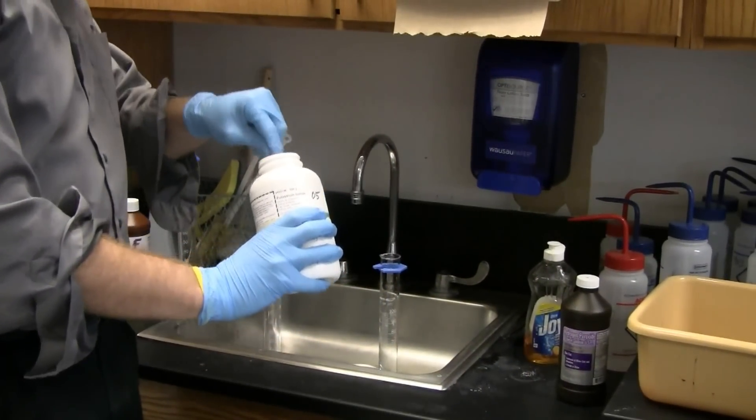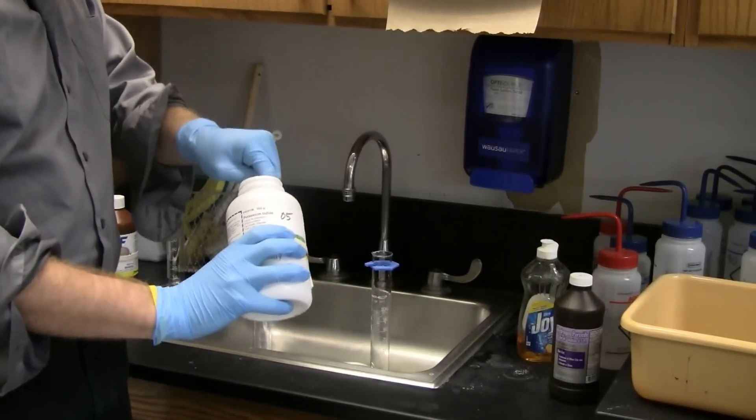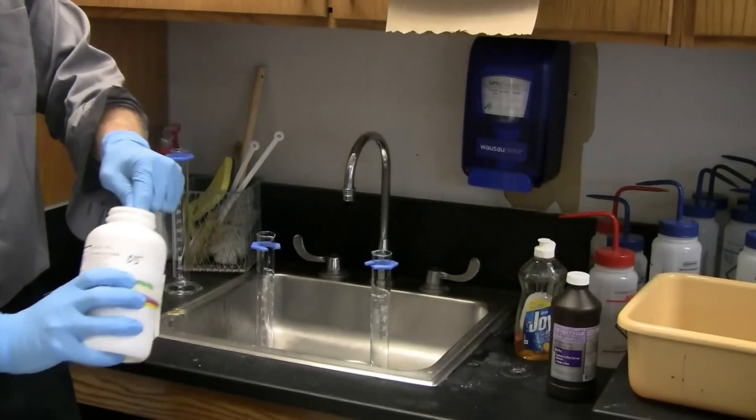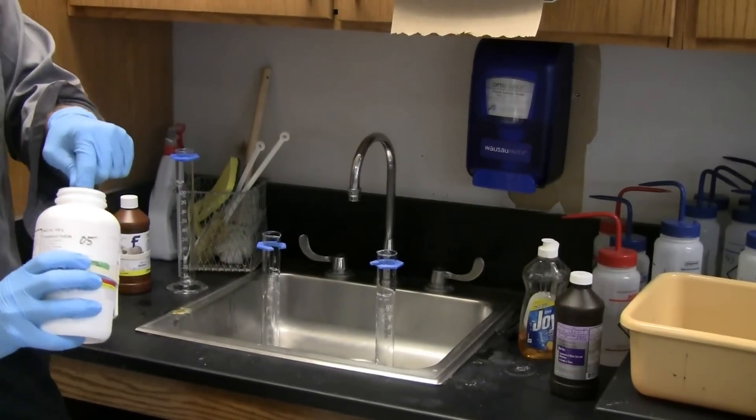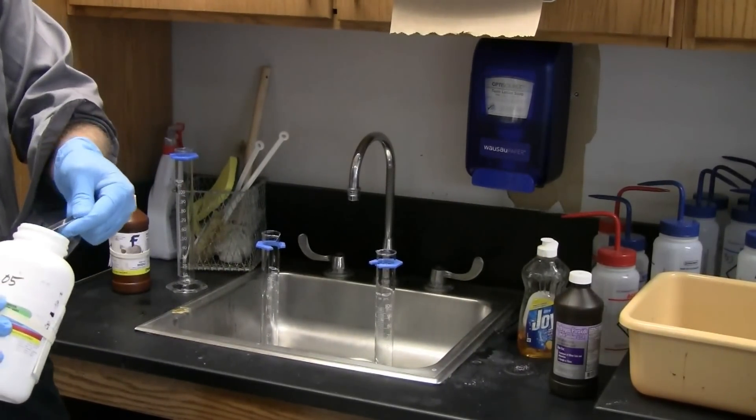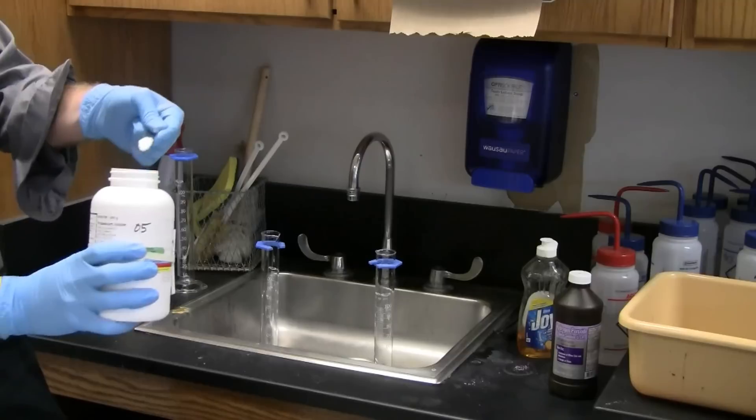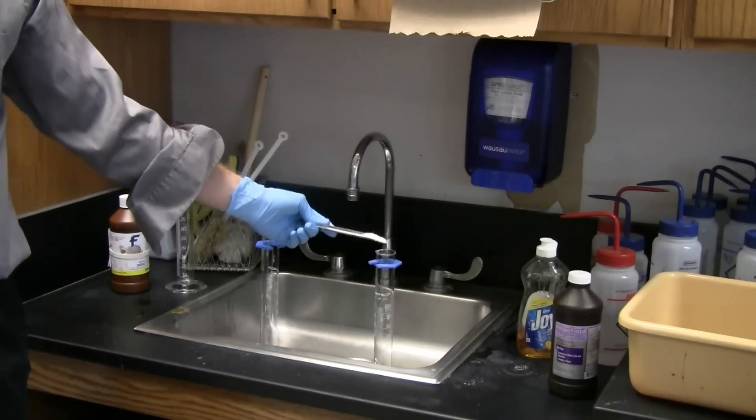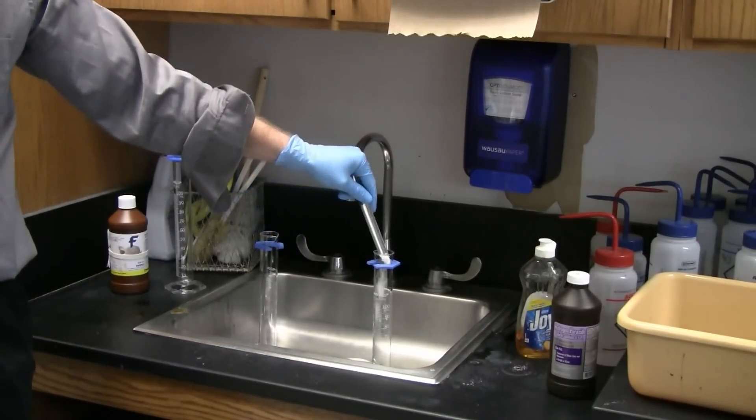Here we go. Normally, hydrogen peroxide takes a couple months, maybe a year, to decompose. But we're going to speed it up. Really? We're going to speed it up quite a bit.